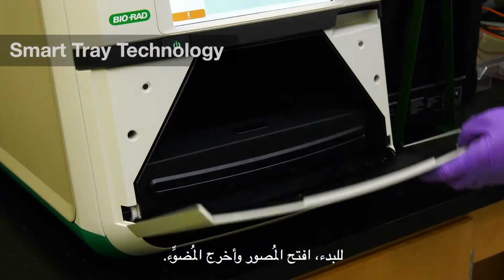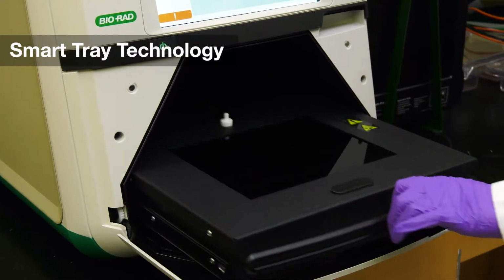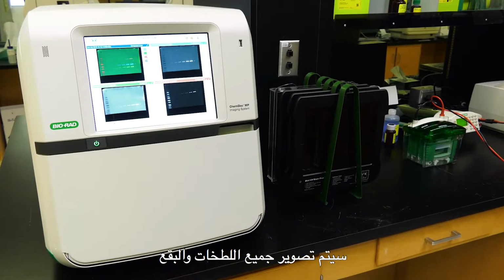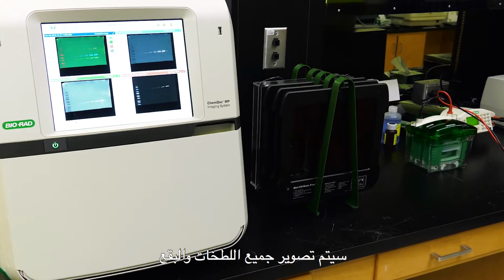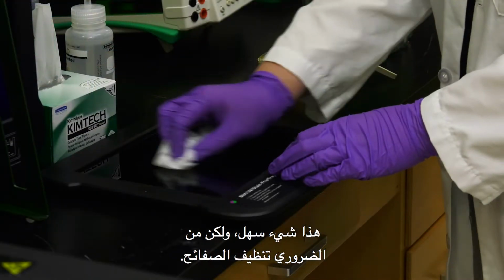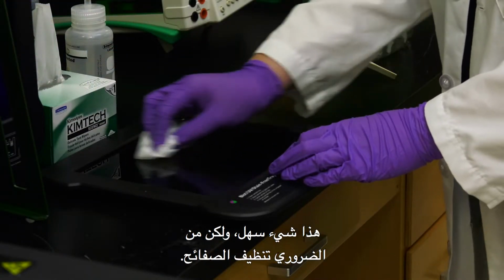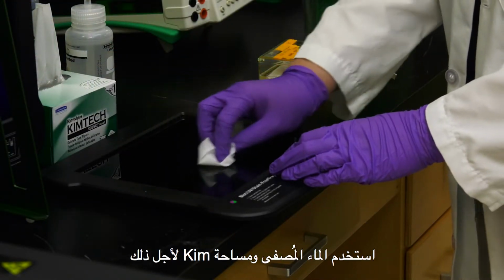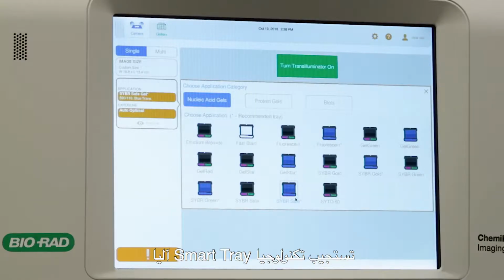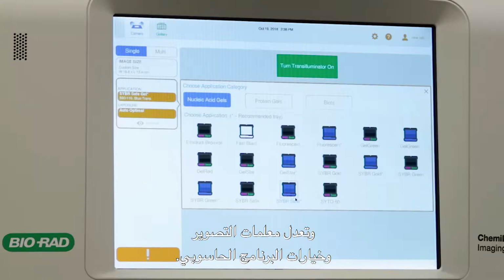To begin, open the imager and pull out the transilluminator. Note that all gels and blots will always be imaged on one of 3 trays. It is easy but important to clean the trays. Simply use DI water and a Kim wipe to ensure optimal performance. Smart Tray technology automatically responds to the application-specific trays and adjusts imaging parameters and software options.